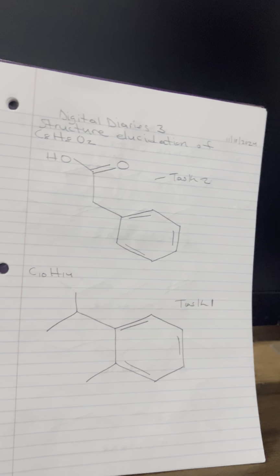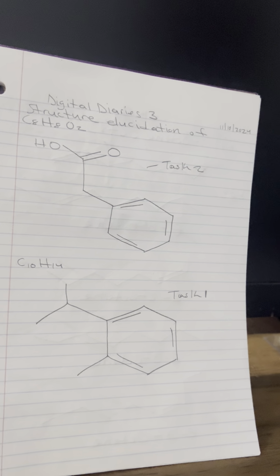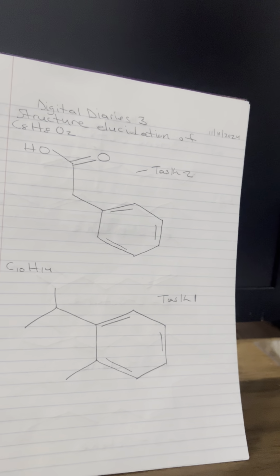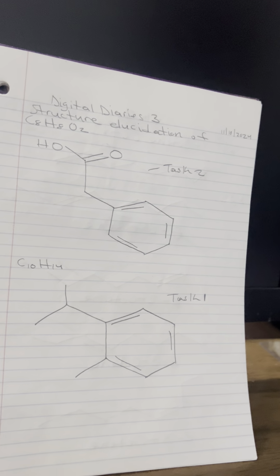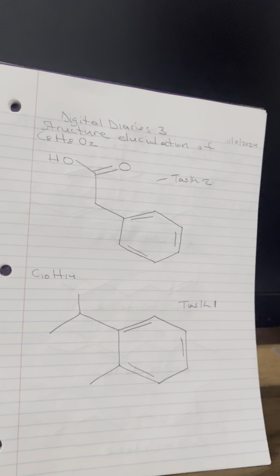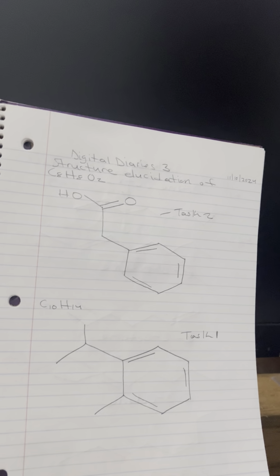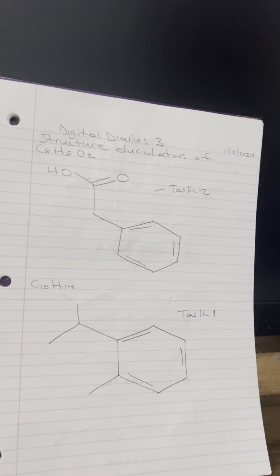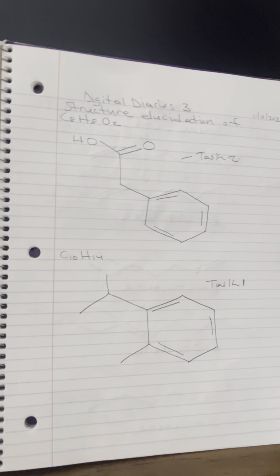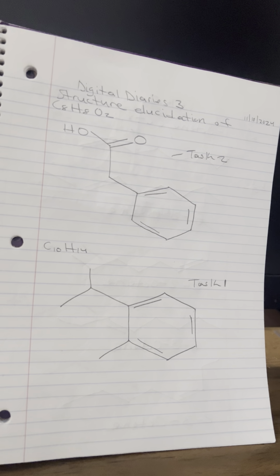Then option 2, you have methyl propionate, which is C4H8O2, with the structure CH3CH2COOCH3. This molecule contains an ester functional group, RCOOR, which will give a C=O stretch around 1,700 cm-1. Esters generally do not show a broad O-H peak, but some esters can sometimes show weak hydrogen bonding peaks if impurities or specific interactions are present. The ester linkage provides 1 degree of unsaturation, again matching the DoU.